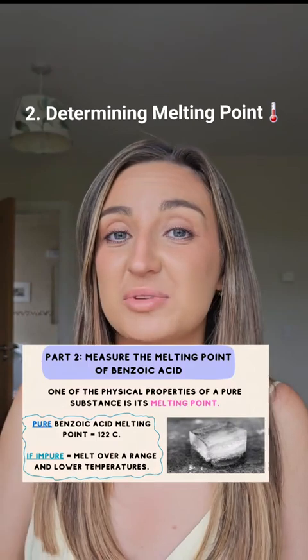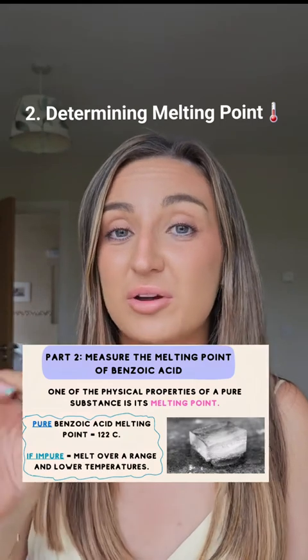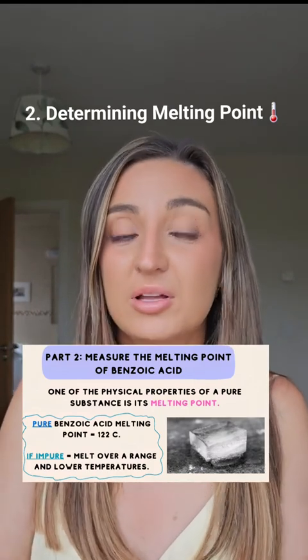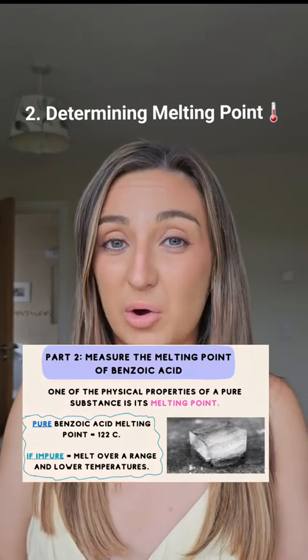So now you have your sample of hopefully purified benzoic acid, but how do we know if we were successful in our recrystallization technique? That's why we do step 2, determining the melting point. So the melting point of a substance is when a substance changes from a solid back to a liquid. Pure benzoic acid we know is going to melt at the narrow temperature 122 degrees Celsius. If we have any impurities left in our sample, we're going to see that the melting point will melt over a range of broader and lower temperatures.